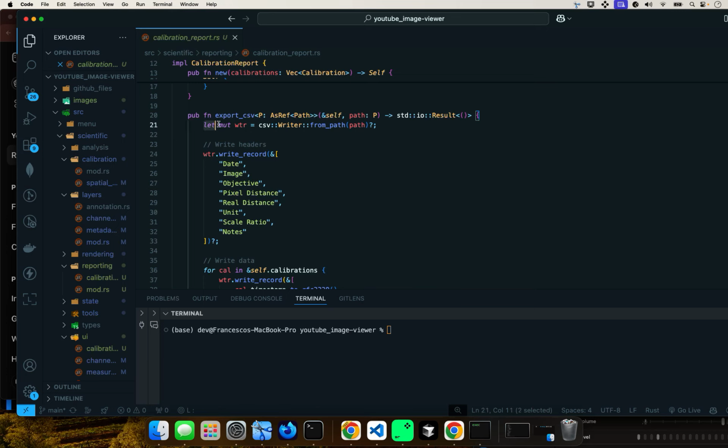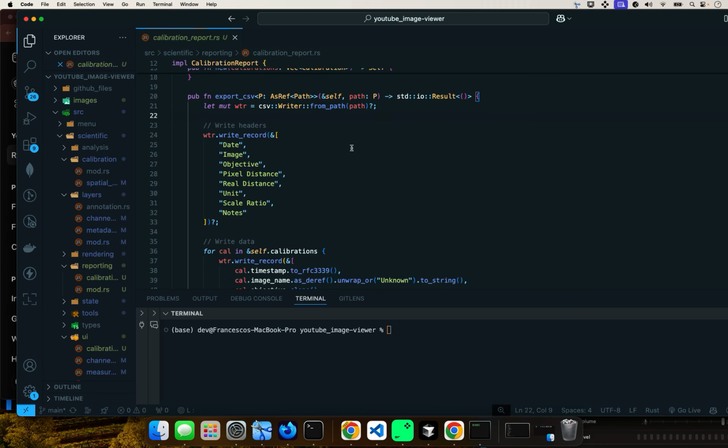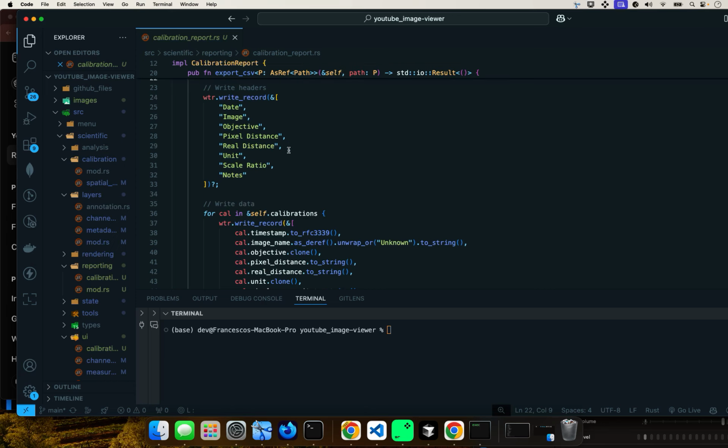Here it is going to create a CSV writer for the specified path. And this operator right here is used for error handling. It's almost like an error E. It's just a way to propagate errors. Here it is going to iterate. It's going to write the header row for the CSV file and give a column name, just like we did in that report that I just showed you. That's what's happening right here. It's going to write the headers.